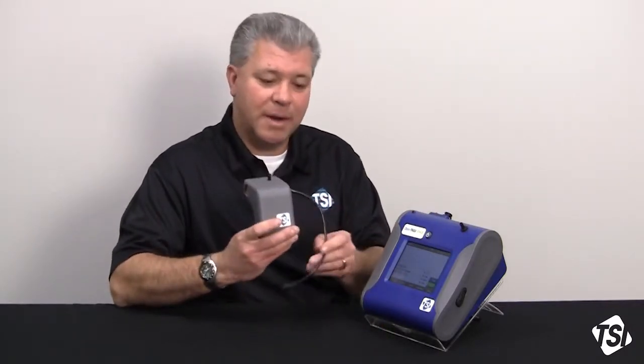Today we're going to be going over how to use a DustTrak desktop instrument, either a DustTrak DRX or a DustTrak 2 with an Auto Zero module. The Auto Zero module was designed and developed specifically for long-term sampling applications. Two of those that come to mind readily are indoor air quality monitoring, where you may be monitoring for 24 hours at a time, and fugitive emissions monitoring, a very common outdoor environmental monitoring application that the DustTrak is widely utilized for.